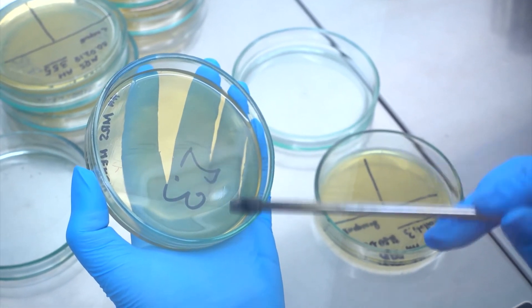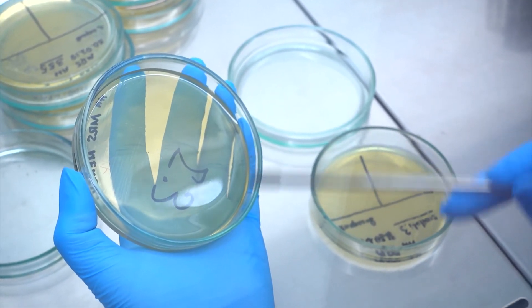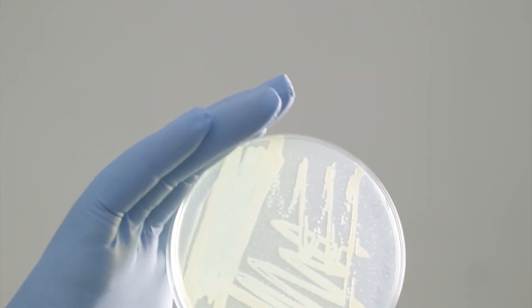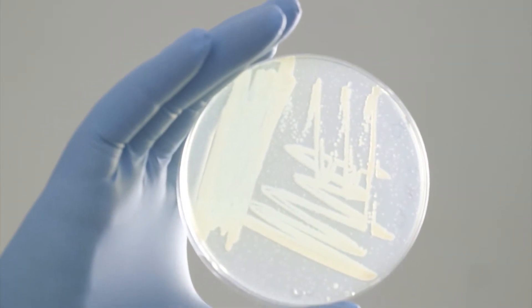Samples are introduced onto culture media in petri dishes. Following incubation, the microorganisms become detectable.